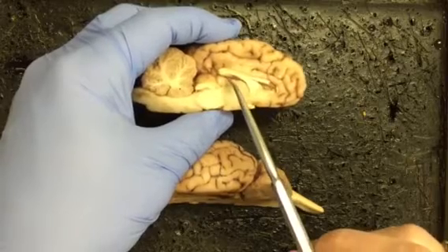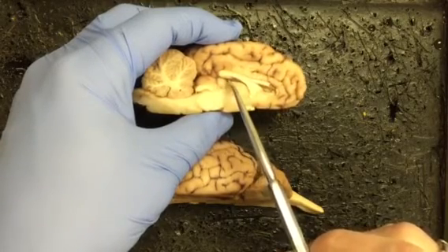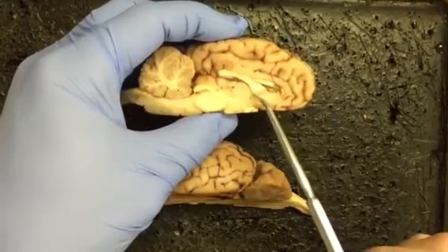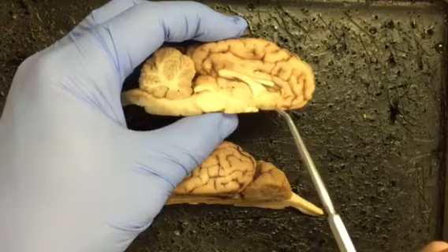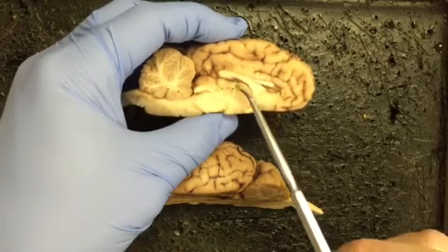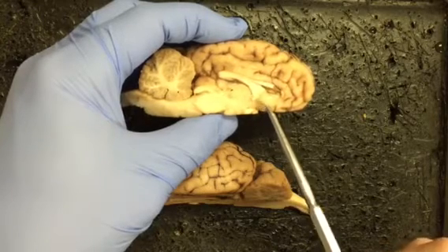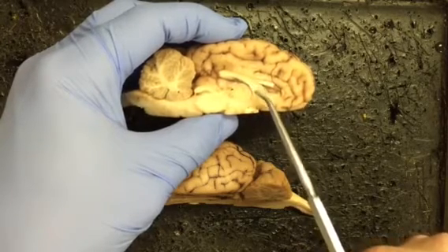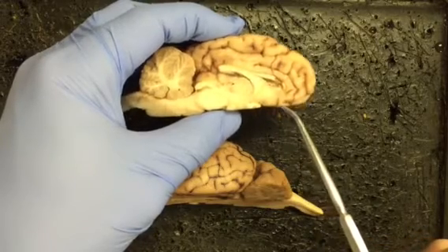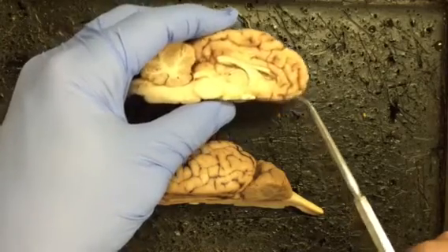Next we have the pineal body, or the pineal gland, and it's tucked away here. The anterior commissure is actually a very small fiber tract that goes anterior to the thalamus. So as a landmark, I would either look for the thalamus and then look in front of it for a little white kind of fiber tract, or you can follow the curvature of the fornix and it terminates down here in that anterior commissure.